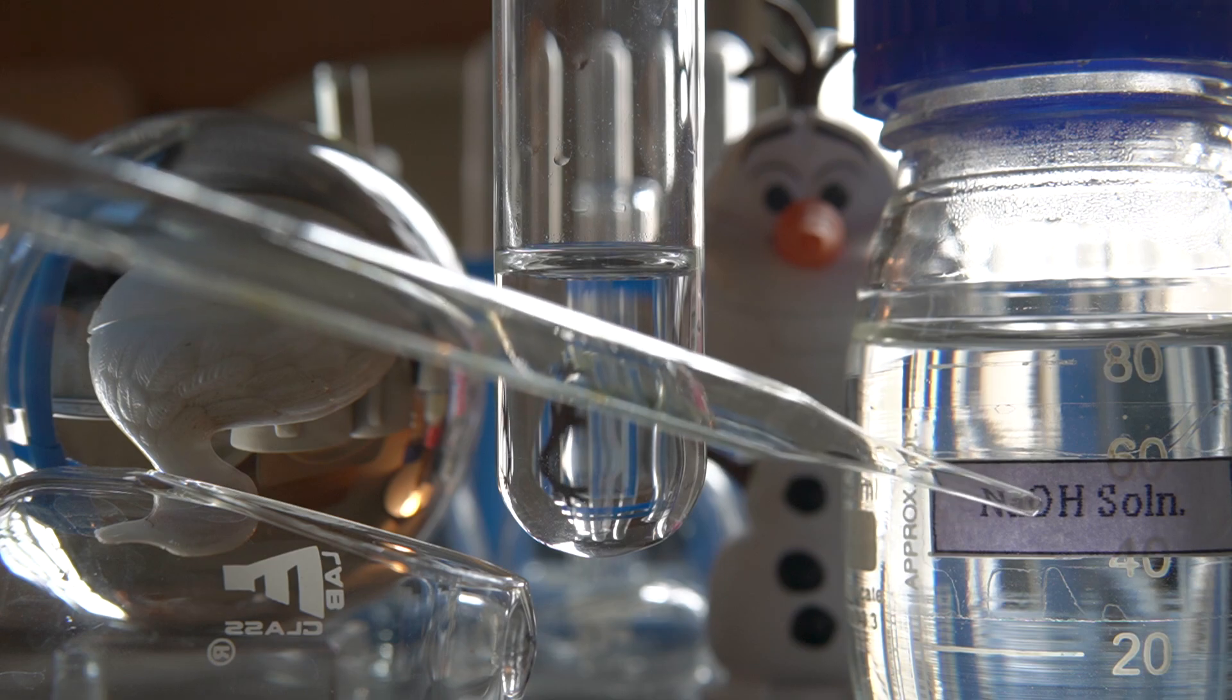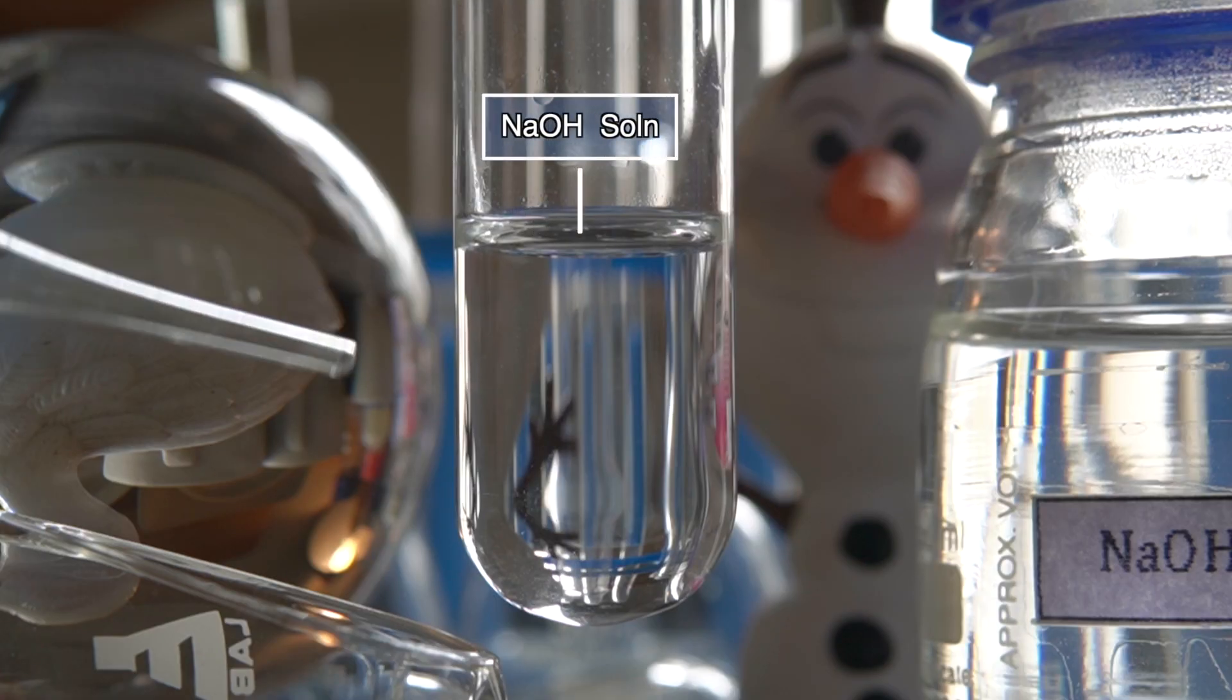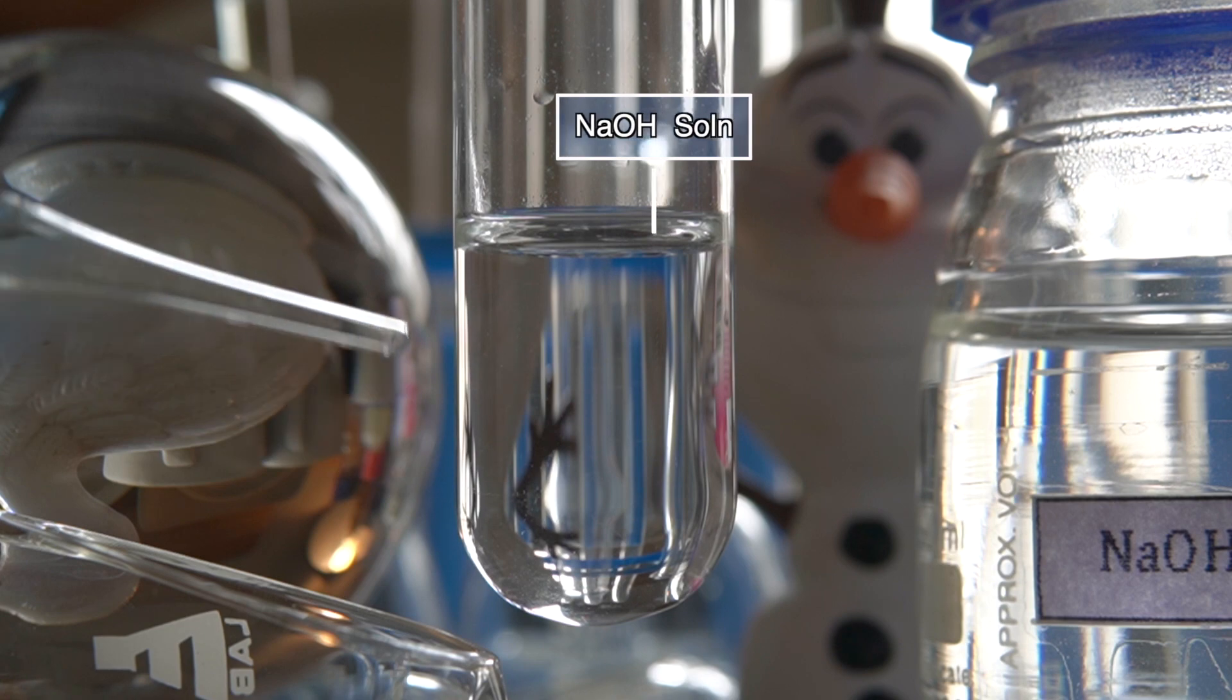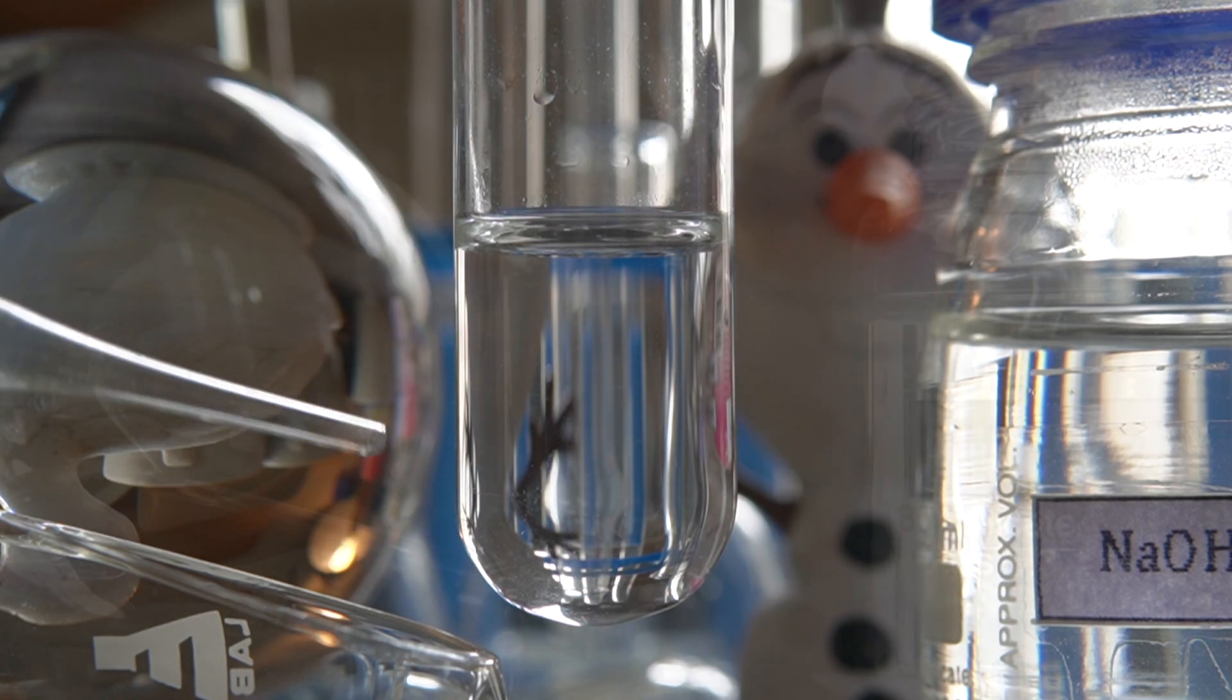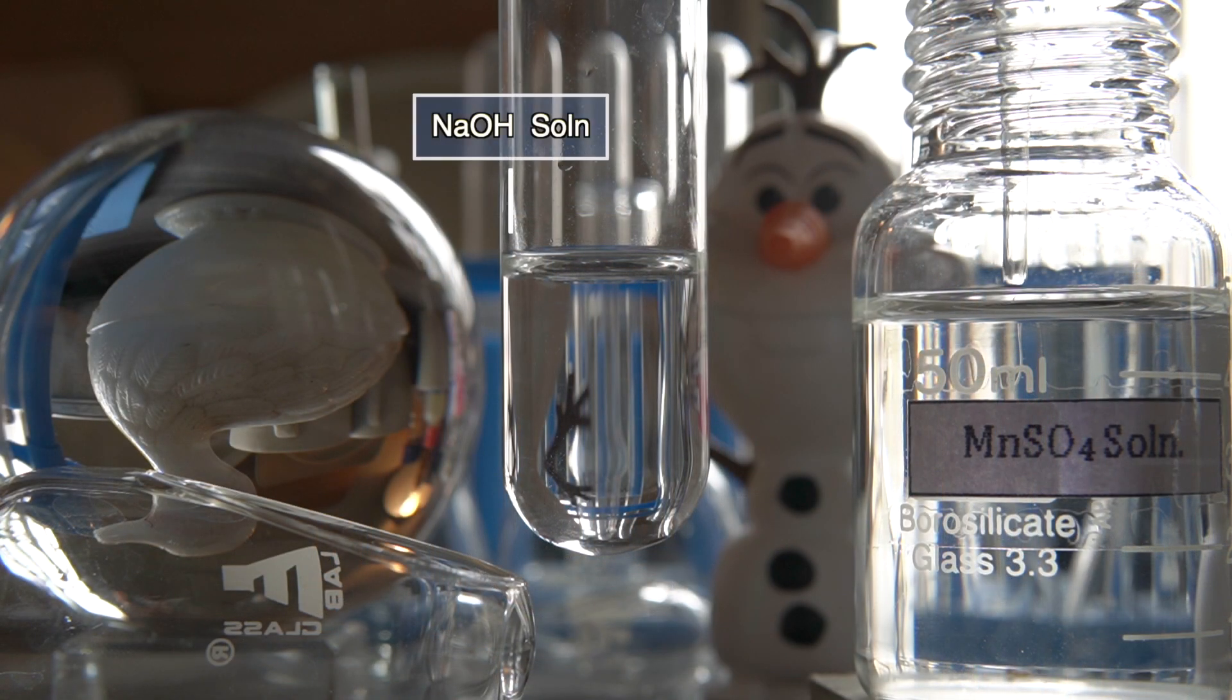Now to initiate the chemical reaction, we will take some amount of sodium hydroxide solution into this test tube.